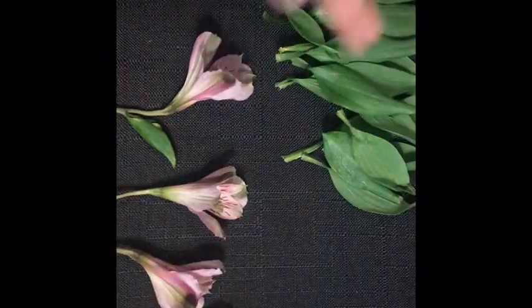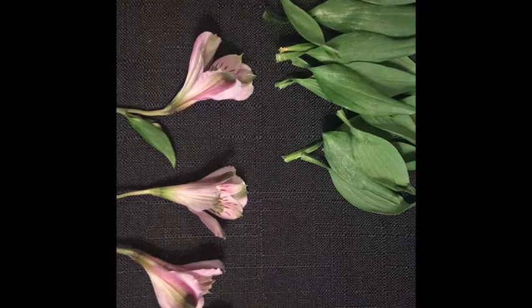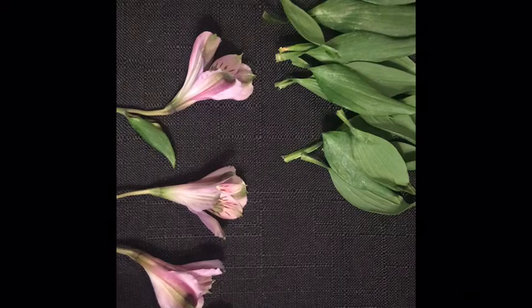So we are going to take off the leaves, and we're going to kind of separate everything as we go here, just to get them out of the way because they are pretty floppy. So I separated our leaves and our stem, and now our flowers. There's a few things that I want to talk about when it comes to the flowers. This flower uses sexual reproduction.